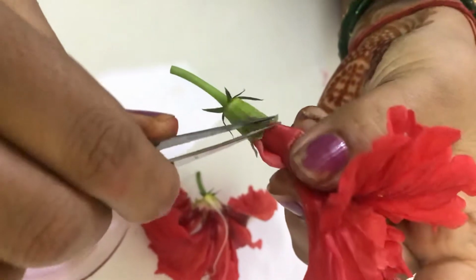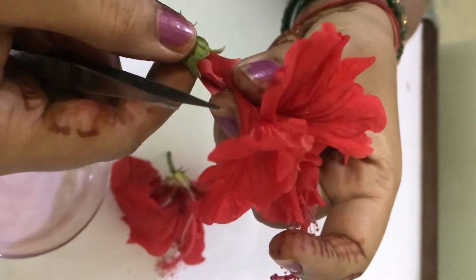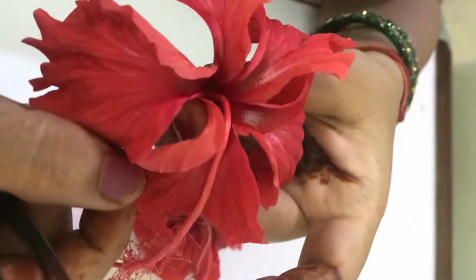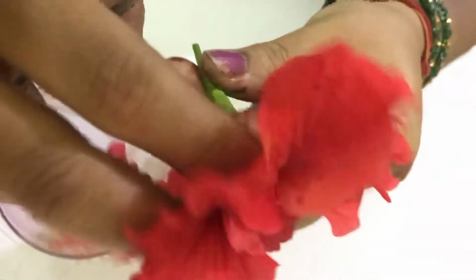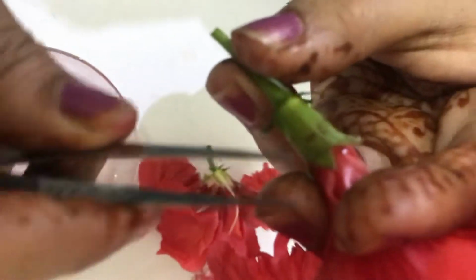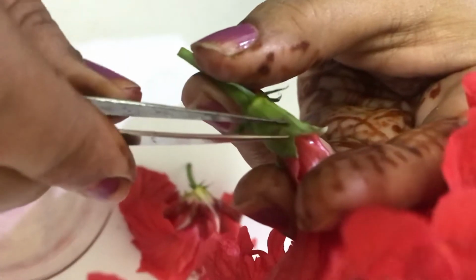In this case, you can see the sepals are fused together, so the condition is termed gamosepalous. Next to this is a bright colored portion, which is the petals. The petals are free, not fused together, so the condition is polypetalous. Now about the estivation. Estivation means the arrangement of sepals and petals with respect to each other. The sepals are arranged end to end, so the condition is valvate estivation.